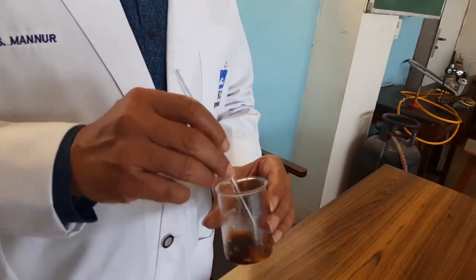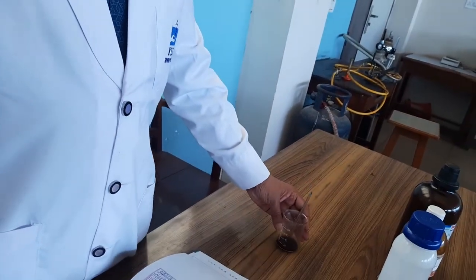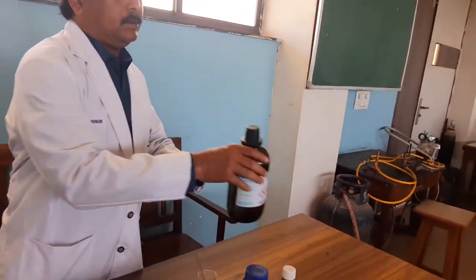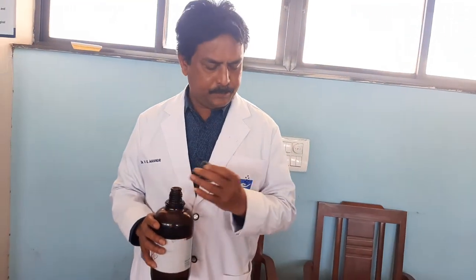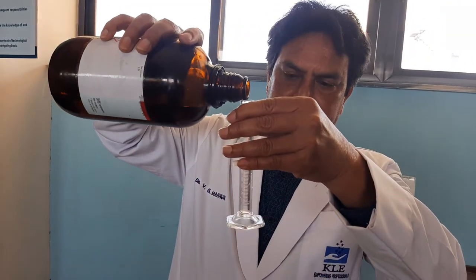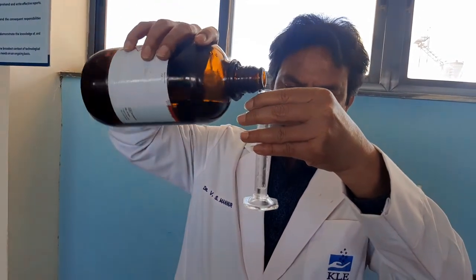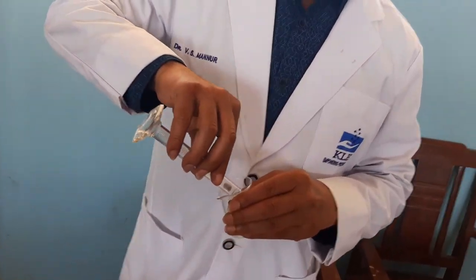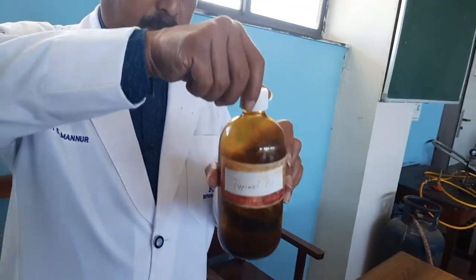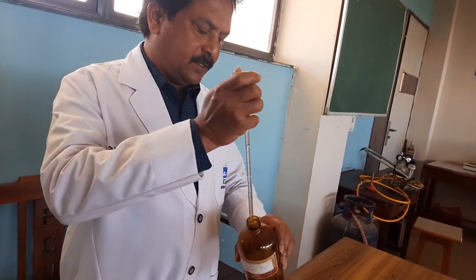Here you can see that iodine is completely dissolved in the solution of potassium iodide. Now keep it aside. Measure the required quantity of alcohol — 1 ml of alcohol 90% — taken in a beaker, and add peppermint oil, which acts as a flavouring agent as well as induces a cool sensation to the sore throat.